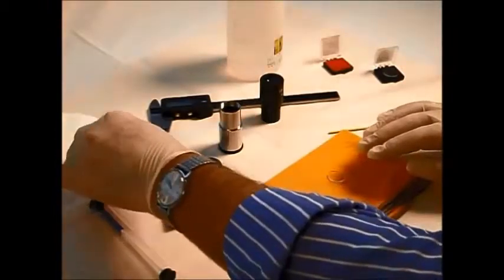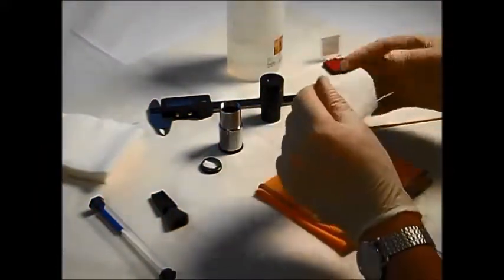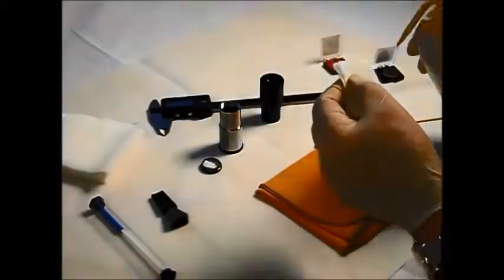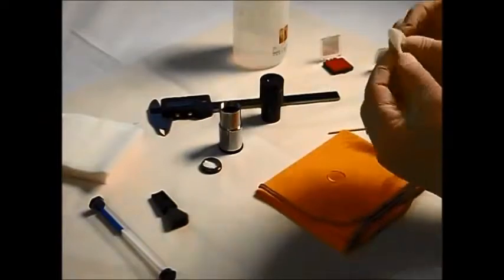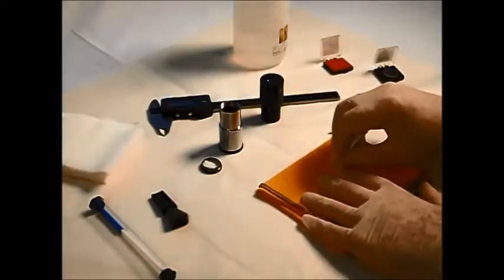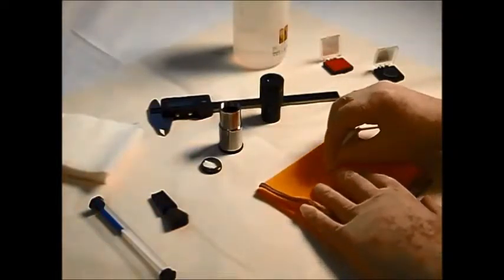The best way to clean it is to take some lint-free tissue like this. Fold the tissue into a square and use the corner as your cleaning surface, and apply some cleaning fluid. There we go. And then work on the lens from the center to the outside in a rotational circular motion like this. It's moving continually to the outside. You're moving any dirt and dust that you've trapped to the outside edge.